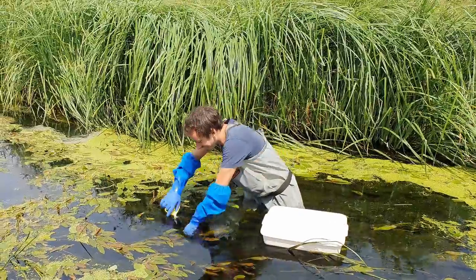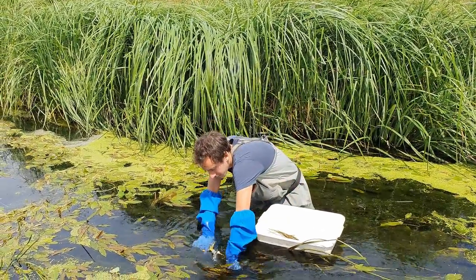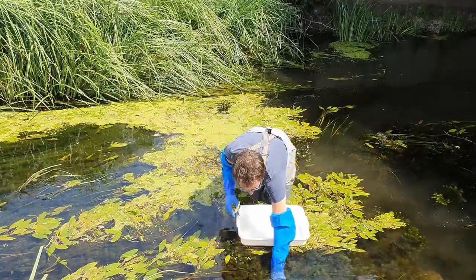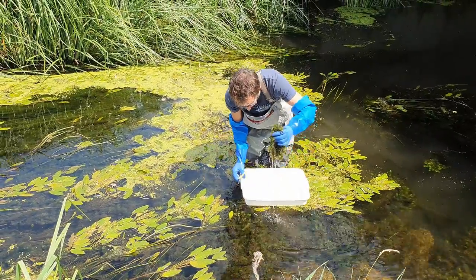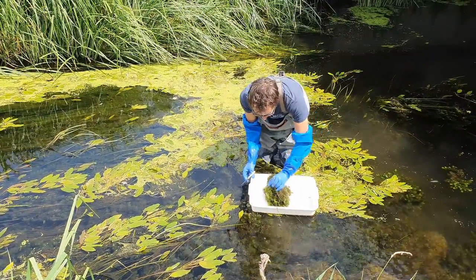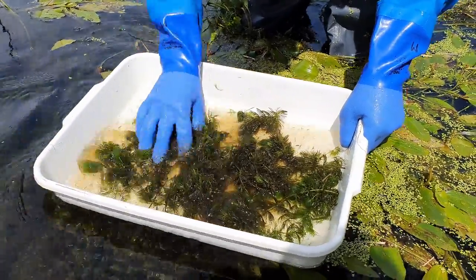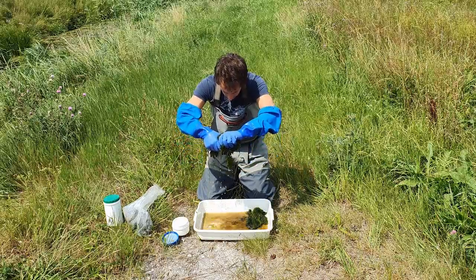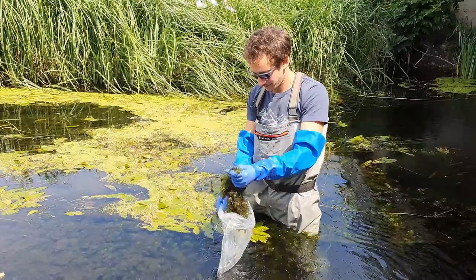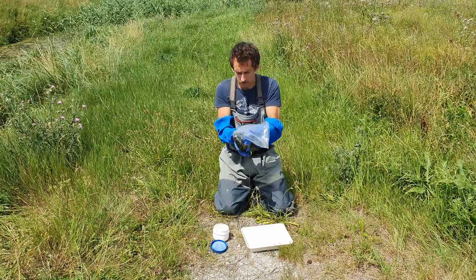The sampling procedure depends mainly on the type of macrophytes which is available. The entire plant or just healthy parts of the plant with a distinct brownish diatom layer are taken using a knife or scissors. Be careful to not include parts which are covered with sediment. At least five healthy plant replicates such as stems, leaves or other plant parts should be selected from an area with distinct flow. Place the sampled macrophytes in a white tray with stream water and move or squeeze the macrophytes to obtain a brownish diatom suspension which is transferred to the sampling container. Alternatively, you can put the sampled macrophytes in a plastic bag or container and obtain the diatom suspension by thorough shaking.